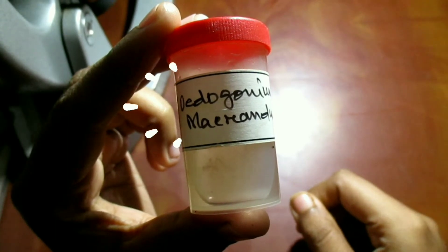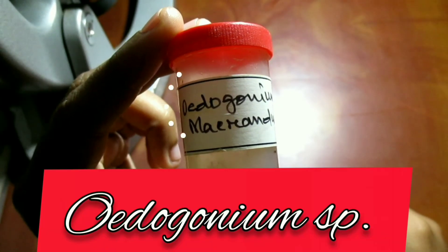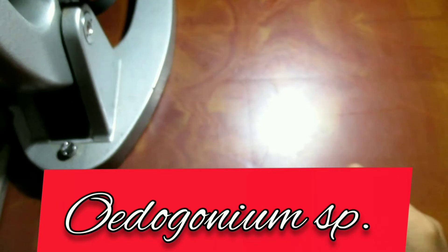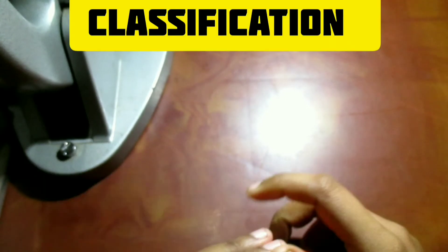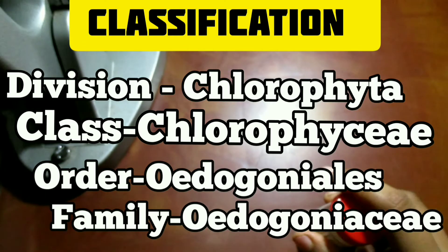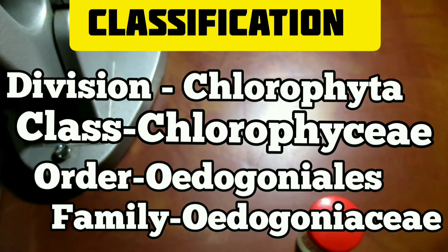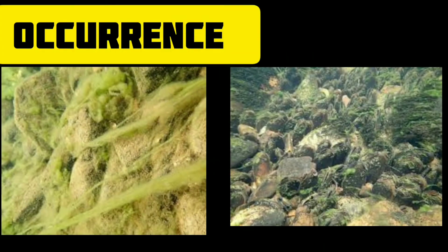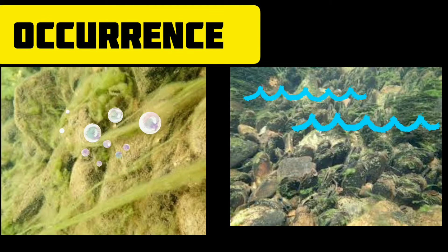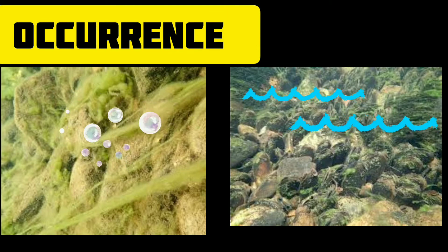The specimen I have is a species of Oedogonium. Let's have a quick look at its classification. Oedogonium belongs to the family Oedogoniaceae, order Oedogoniales, class Chlorophyceae, and division Chlorophyta.